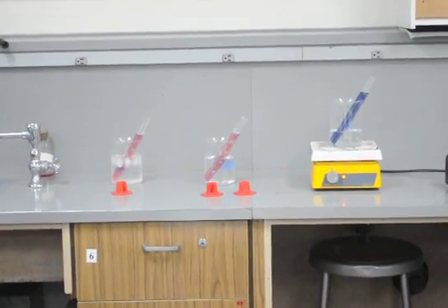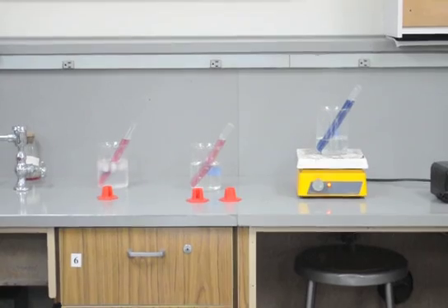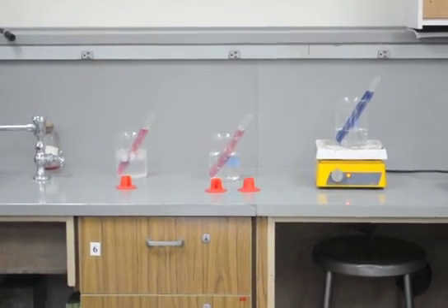Okay, now that they've cooked for a little bit, Edgar, would you please go over there and pull that nice blue one up and let us take a look at that.